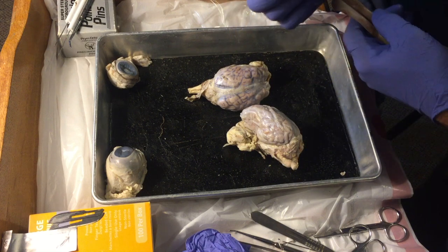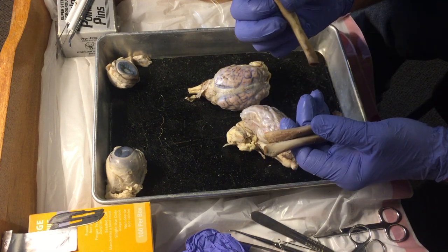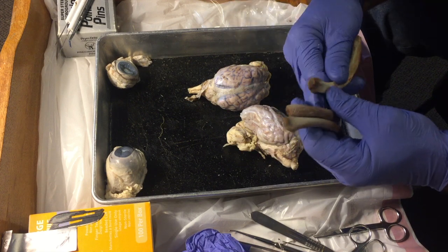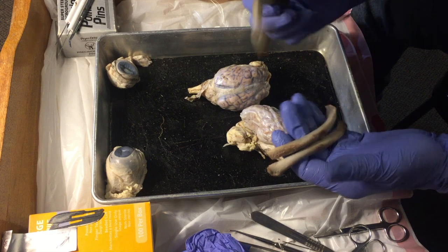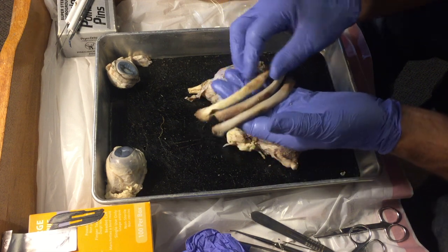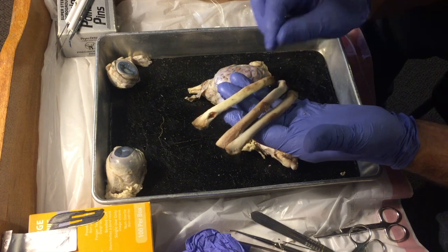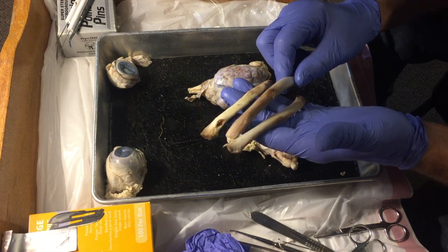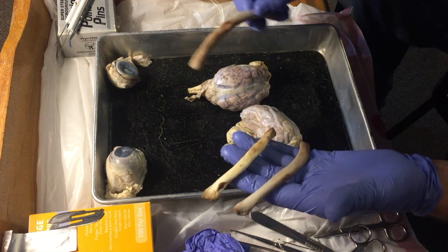So if I take this rib bone, these are rib bones, had ribs the other night. These are from a pig, okay? And so if I tap it here, you can see that's a fairly hard bone. So these are all from the same rack of ribs, and I took two more bones from that same rack, and I put them in 10% hydrochloric acid overnight and a day, and basically turned them into this.